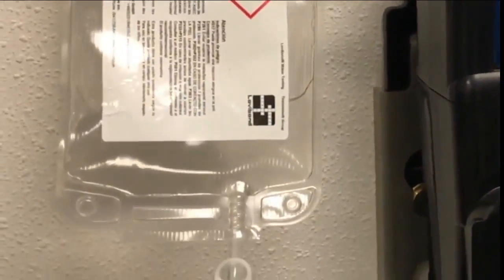From here, let the TCAL Plus standard completely empty from the pouch. A wait of 60 seconds is preferred.